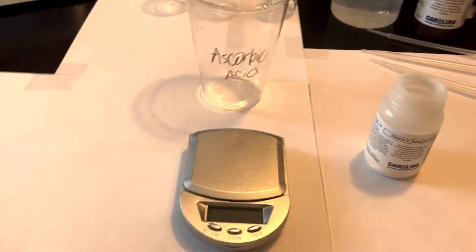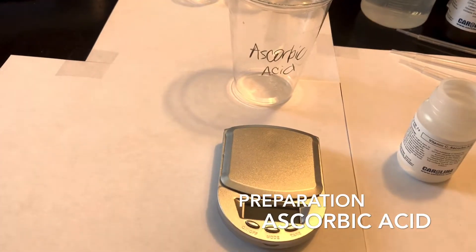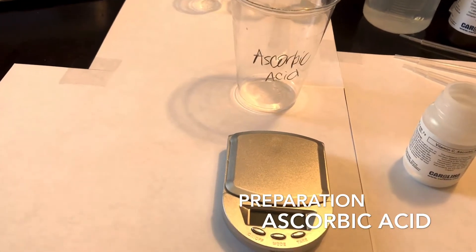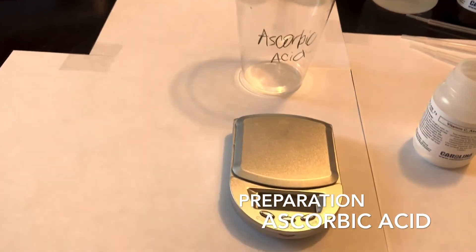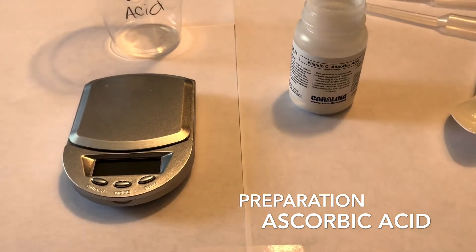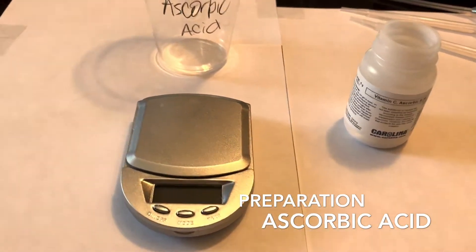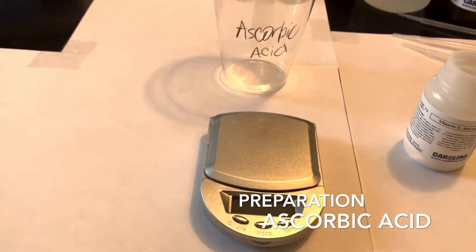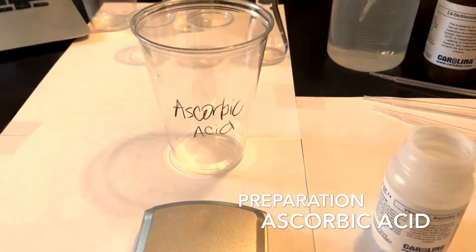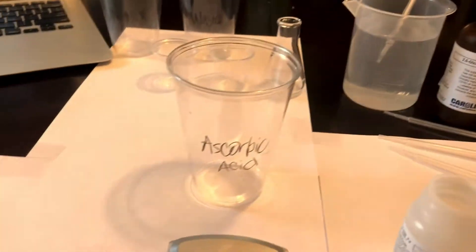Let's get into it. The first thing to do is to prepare the 2 gram per liter stock solution of ascorbic acid. So what we will do is measure out 0.5 grams of the vitamin C ascorbic acid and put that into our ascorbic acid cup and then put 250 ml of water into it.